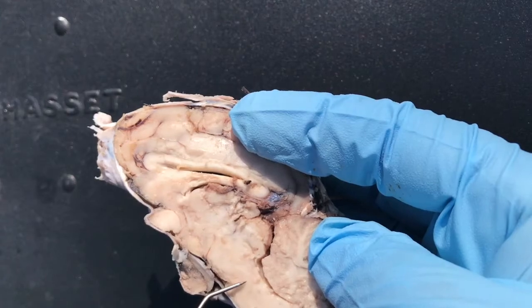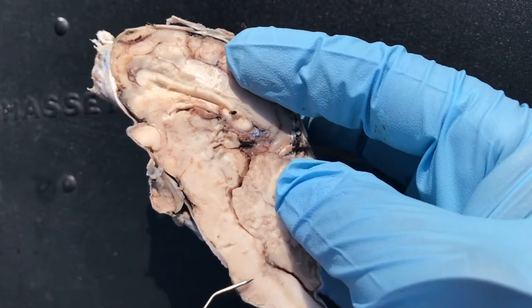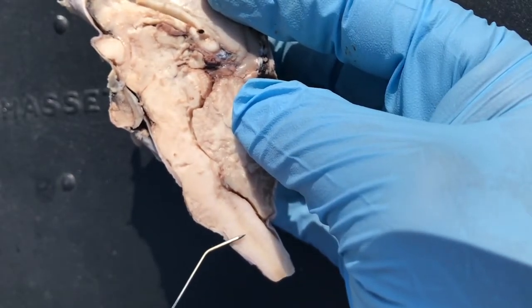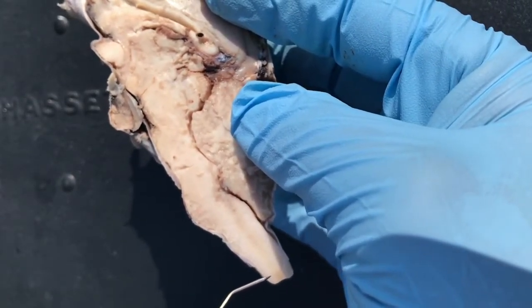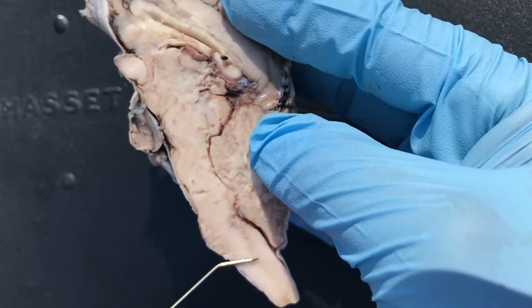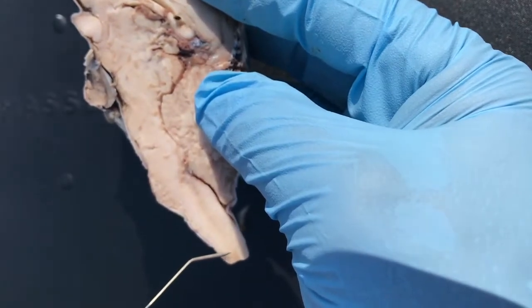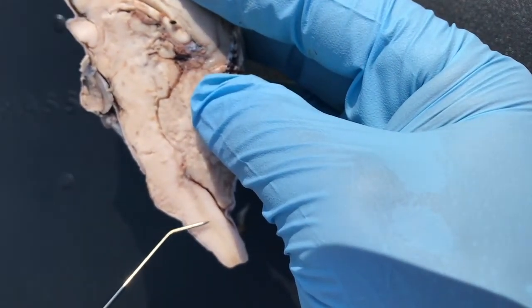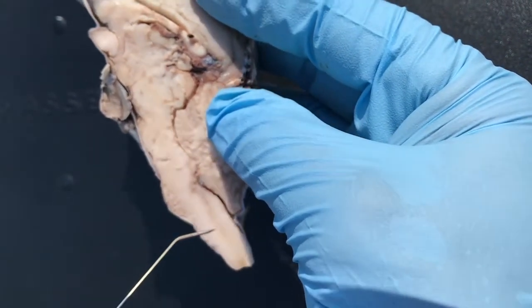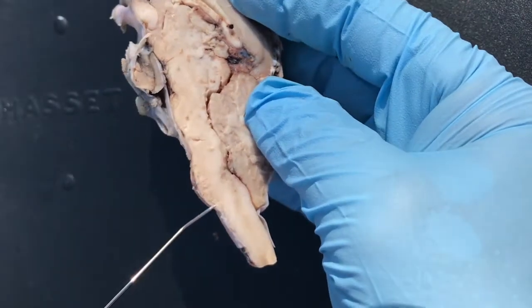Then you have your tegmentum, and that's right here. Then you have your pons. Then you have your medulla oblongata. And then finally, at the very bottom here, you have your spinal cord. So let's start from the inferior here and work our way up. Here is the spinal cord right here. And then just above that, but before we hit the pons, this is your medulla oblongata right here. So: medulla oblongata, then we have our pons — you can see that ball right here, that's the pons.